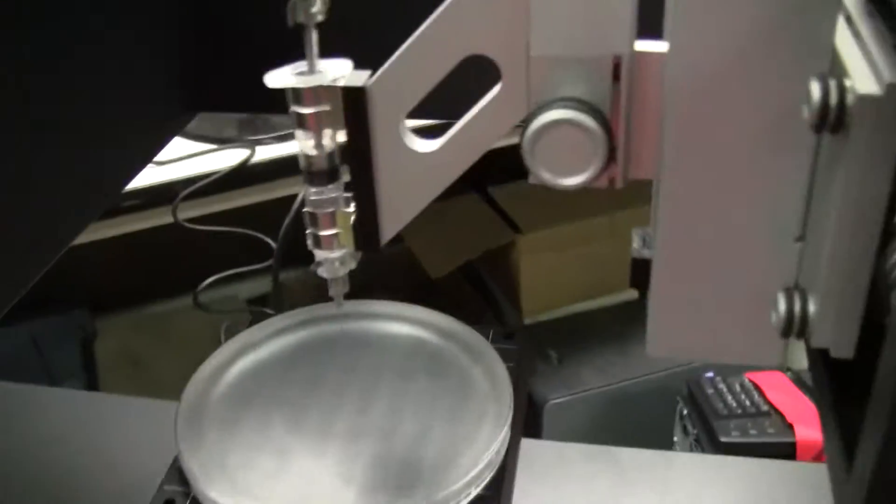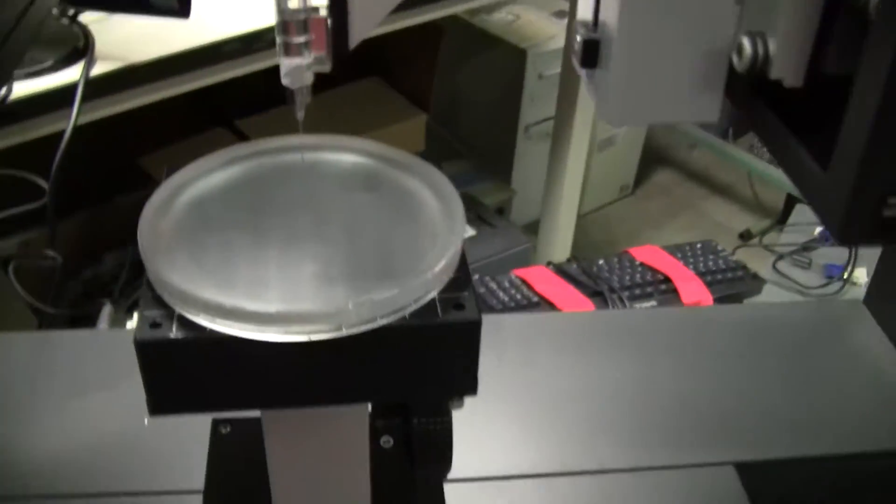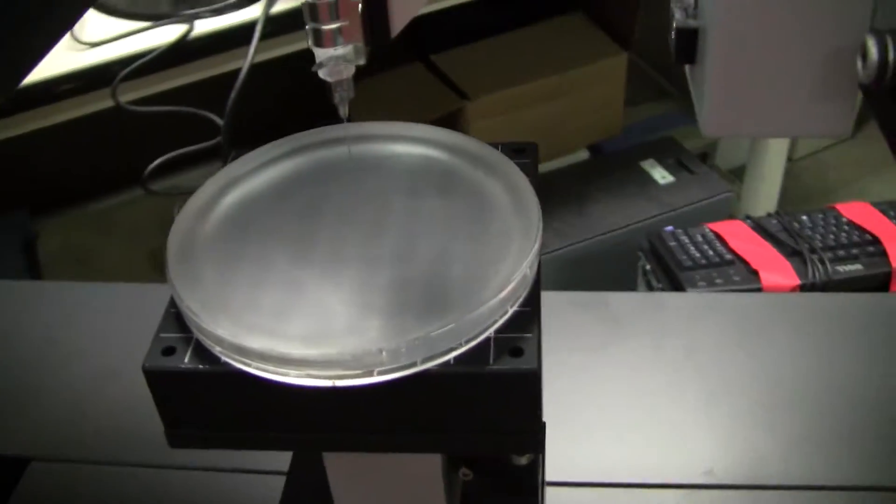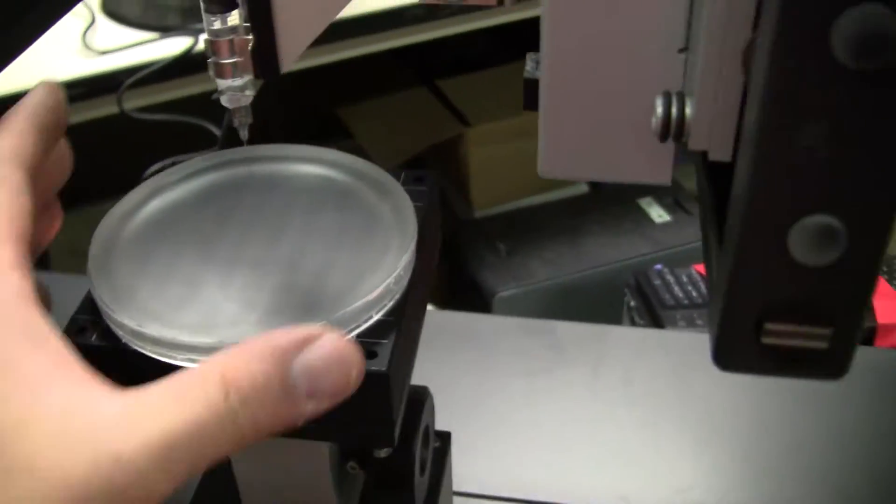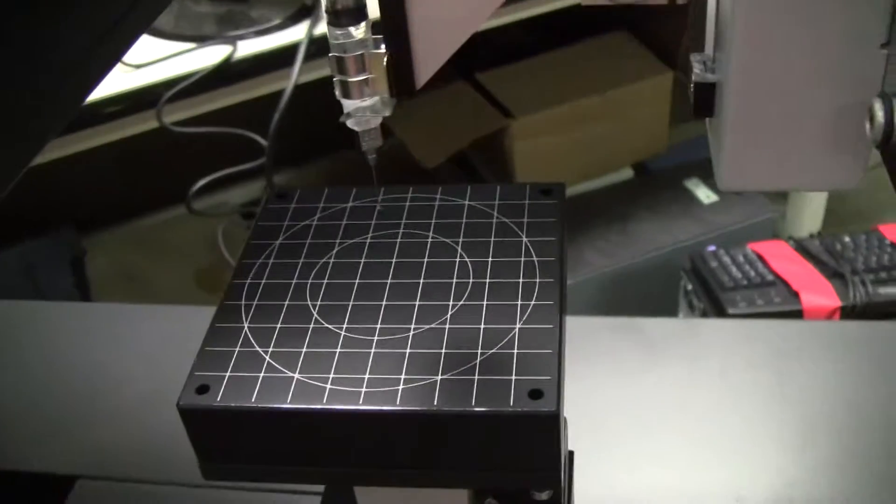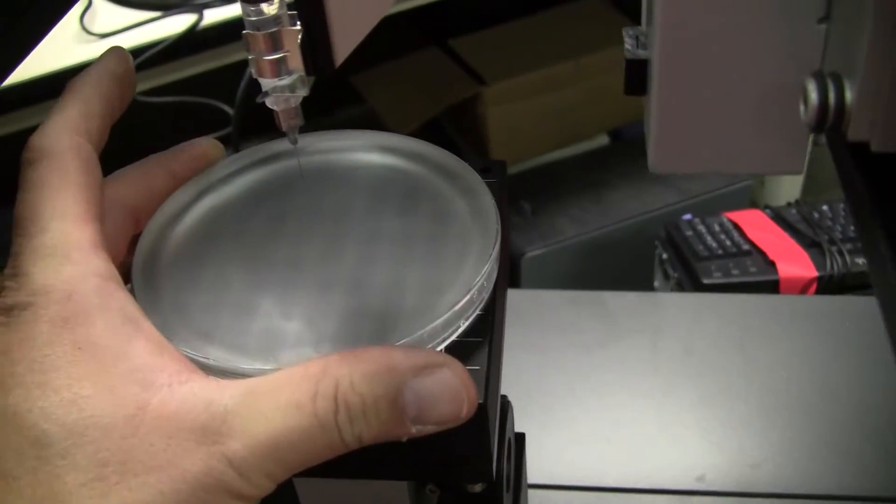We have a simple syringe filled with water. I just put a glass surface here. This does not come with the instrument, it actually holds my coffee, but for this experiment it's going to work.